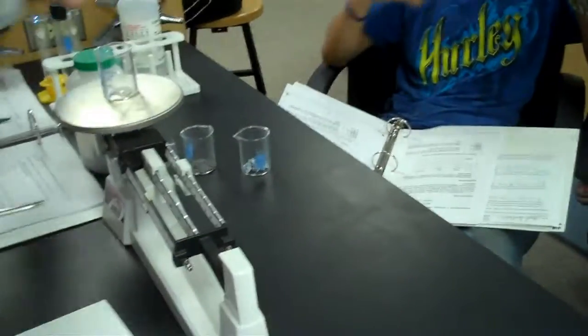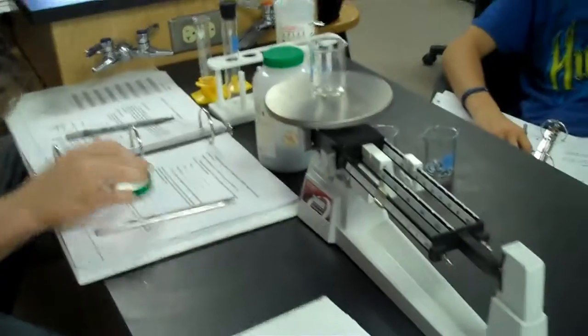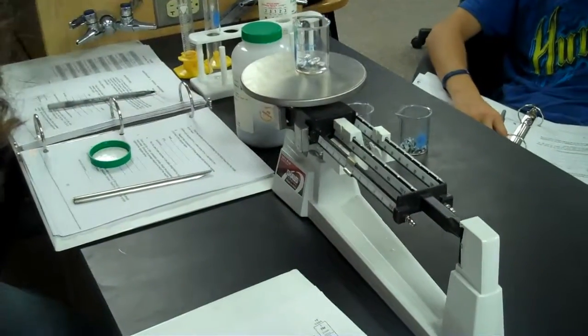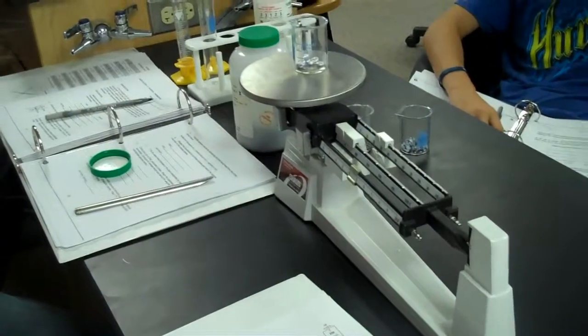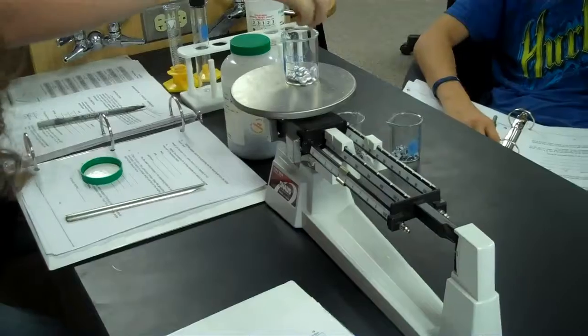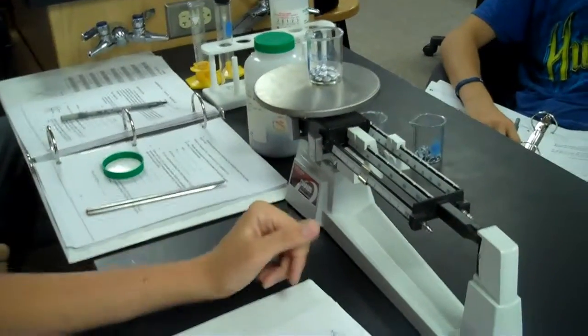Okay. Basic formatting. And so now we get to do the same thing with the aluminum. So grab number 3. You can do more than that if you want. There's only a handful more. There you go. Okay, that's good.